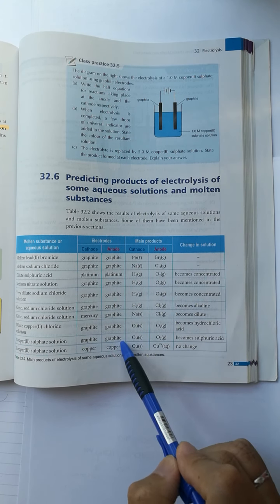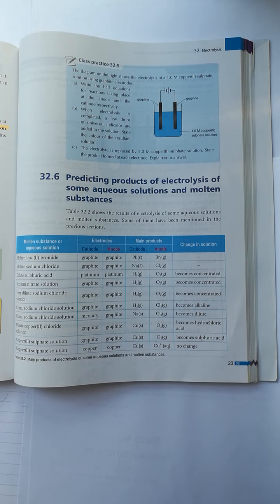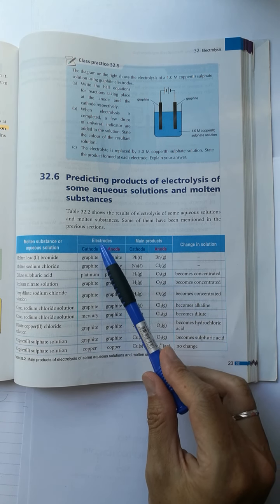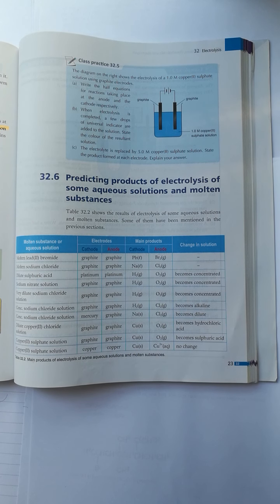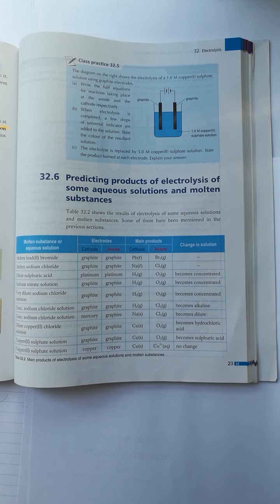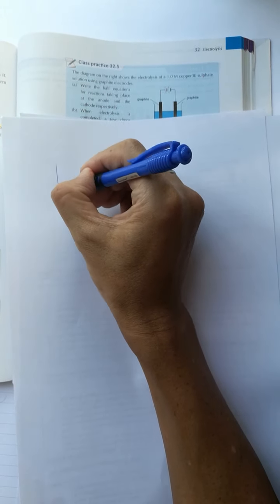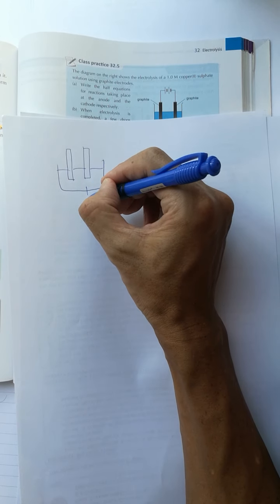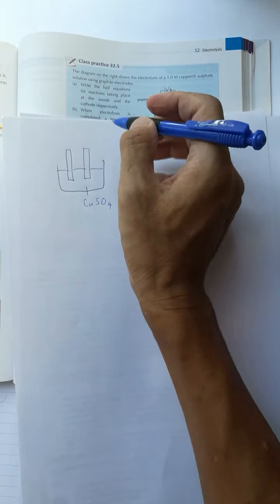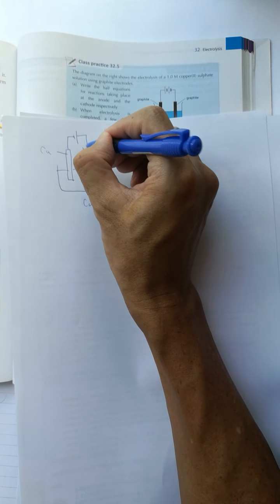After using graphite electrodes for electrolysis of copper sulfate solution, we now replace the graphite electrodes with copper electrodes. The setup is a solution of copper sulfate with two copper electrodes connected to a power supply.